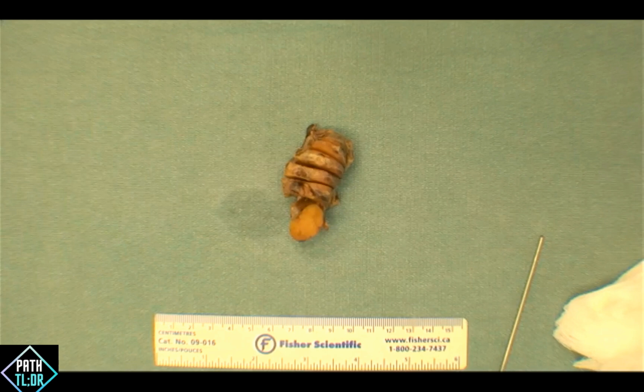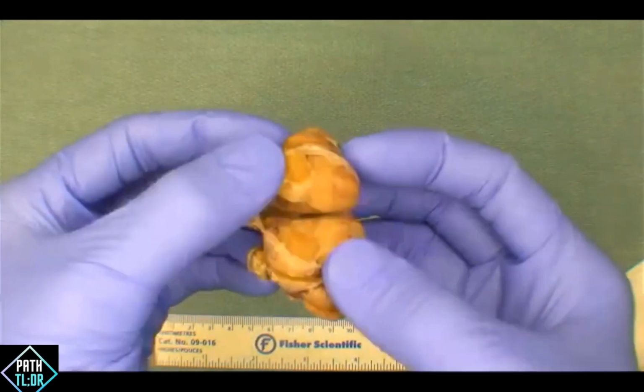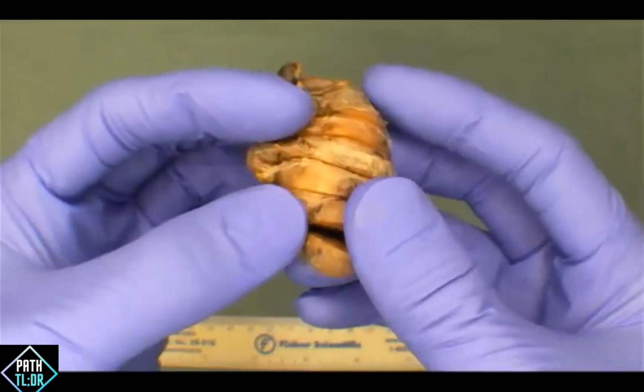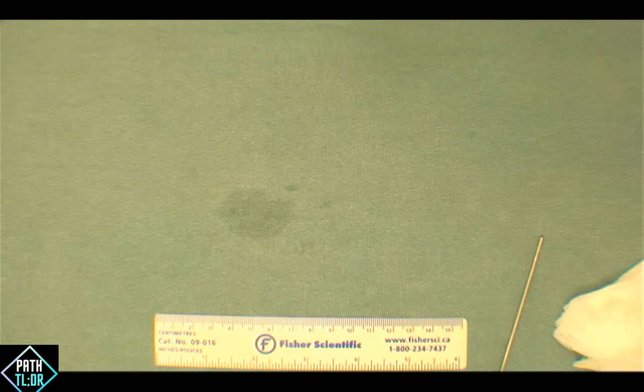Okay. So I think when it comes to this specimen, with some of the differential that we've been talking about in the chat, favoring something from an adenoma to something follicular is definitely higher up on the list. Okay. We'll get back to how we gross these things after. We'll do them all together with our third and final specimen.